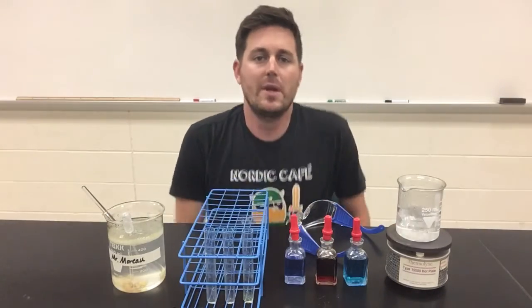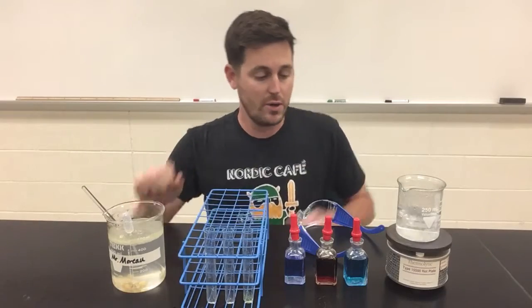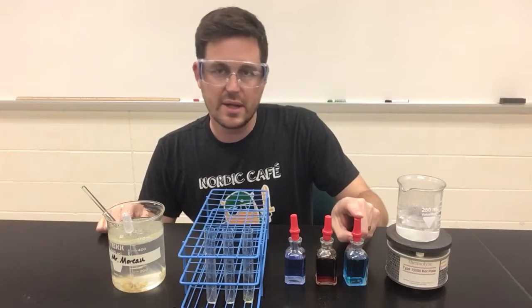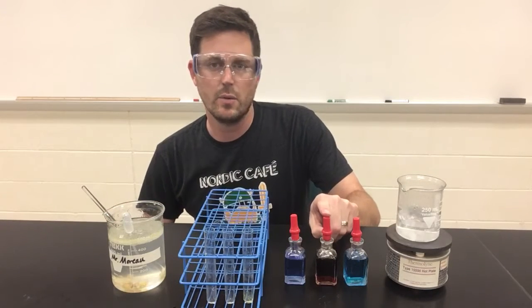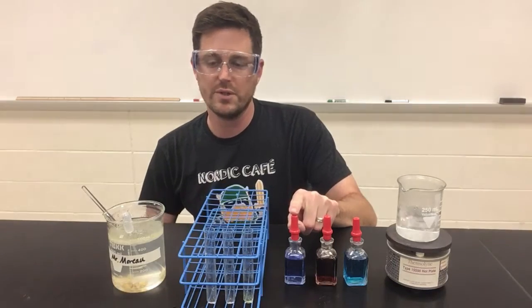Hi, this is Mr. Moreau, and I'll be conducting the indicator tests for my own sample of vomit for our Unknowns Vomit Lab. So what I've got here is the Benedict's test, which, as you recall, tests for monosaccharides, the iodine test, which tests for polysaccharides, and the Biuret's test, which tests for the presence of proteins.